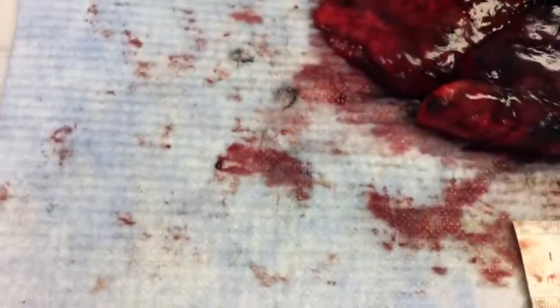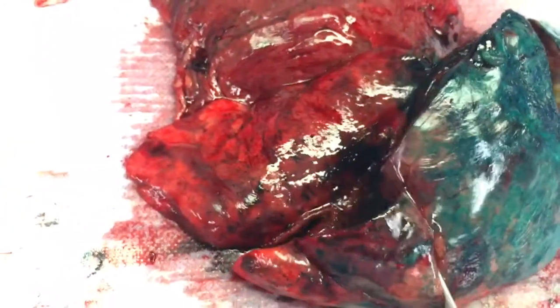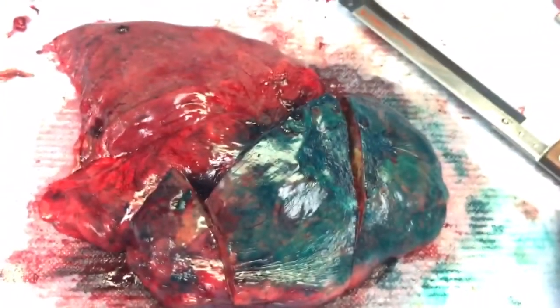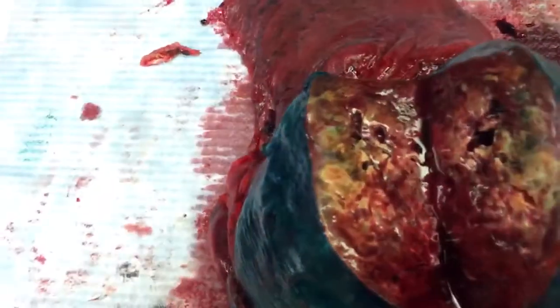I'm going to go down — we're still in the upper lobe — to a normal section and cut that for you. This is what normal lung should look like. See how it's beefy red? That's normal. And then you go up here — that's tumor.